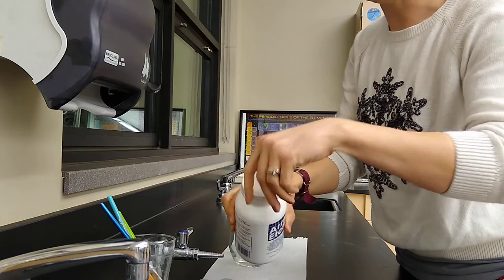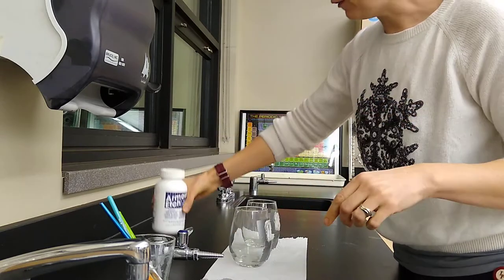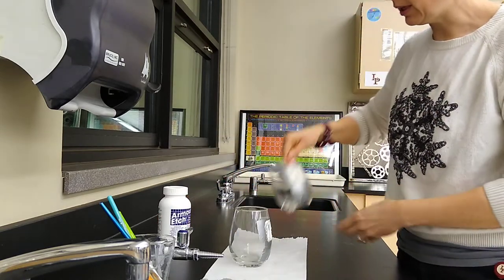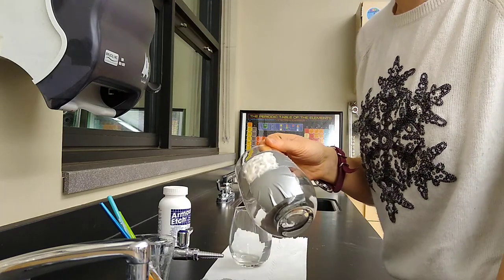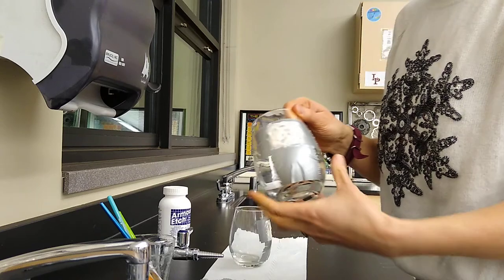Okay, then the final step. So this one has been sitting here. It needs to sit for about five to ten minutes. It doesn't need to sit any longer than that, but once it's been sitting there for that long, you're going to rinse this in the sink.